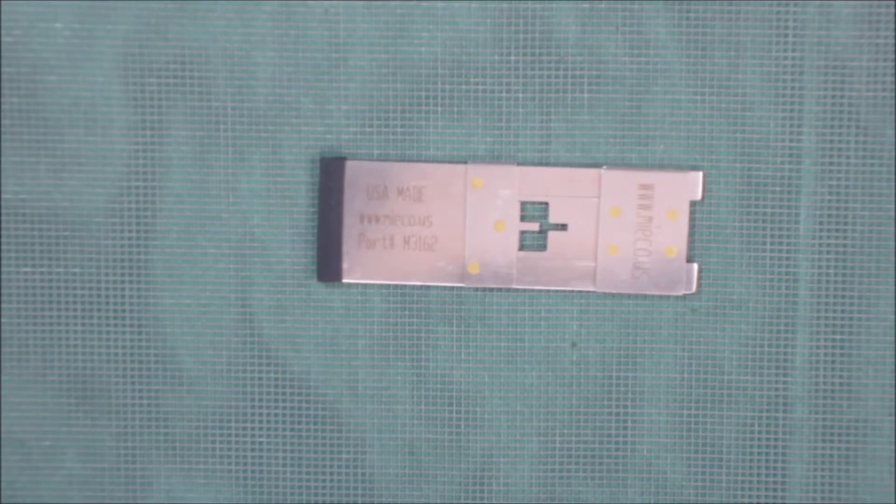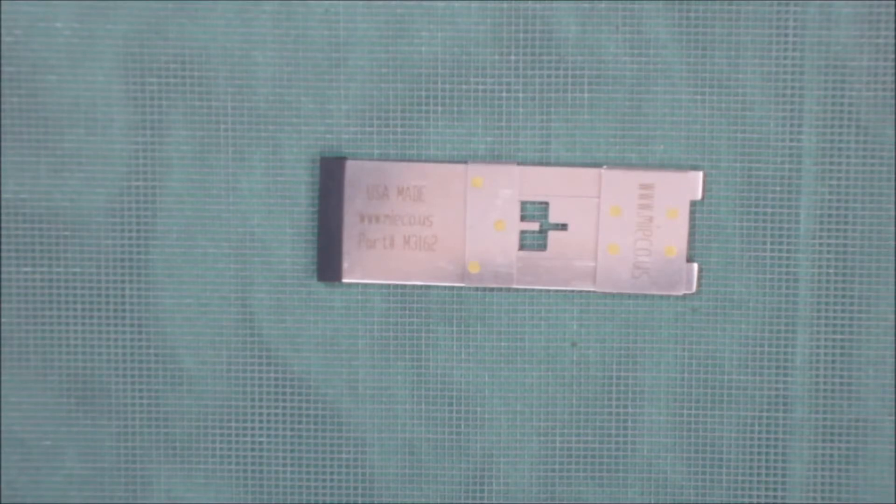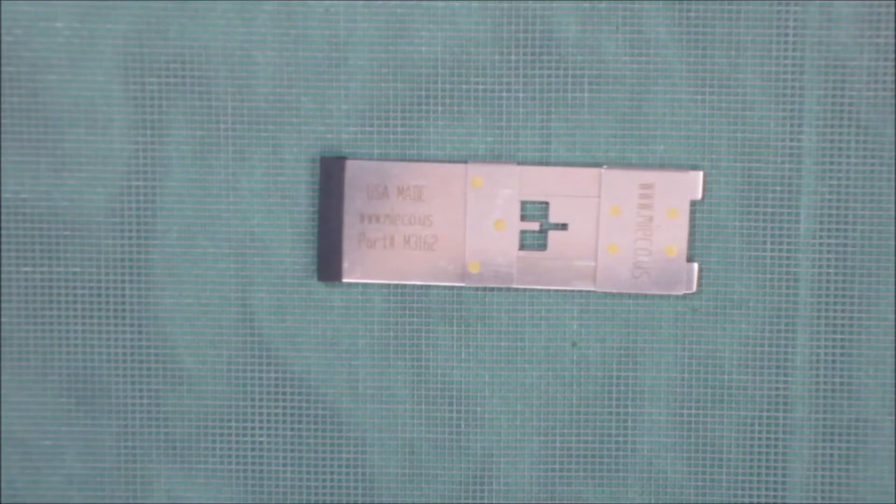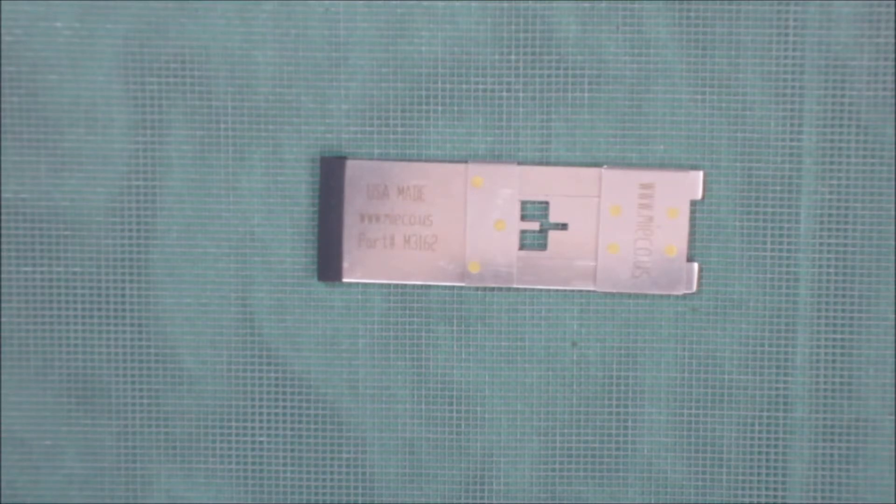This one is the newest and widest slot that we have. The width is 0.062 of an inch or 1.6 millimeters wide. Most like thinner slots because the fibers are usually thinner than what I use.